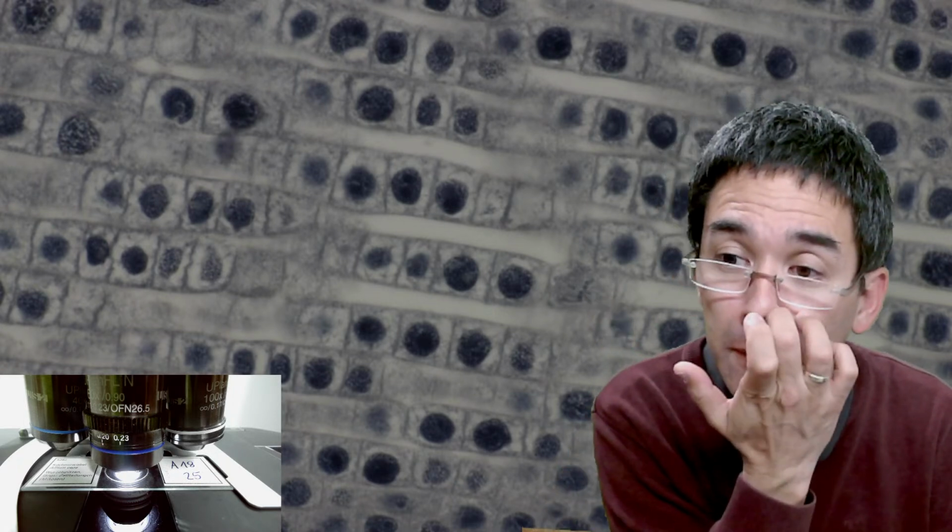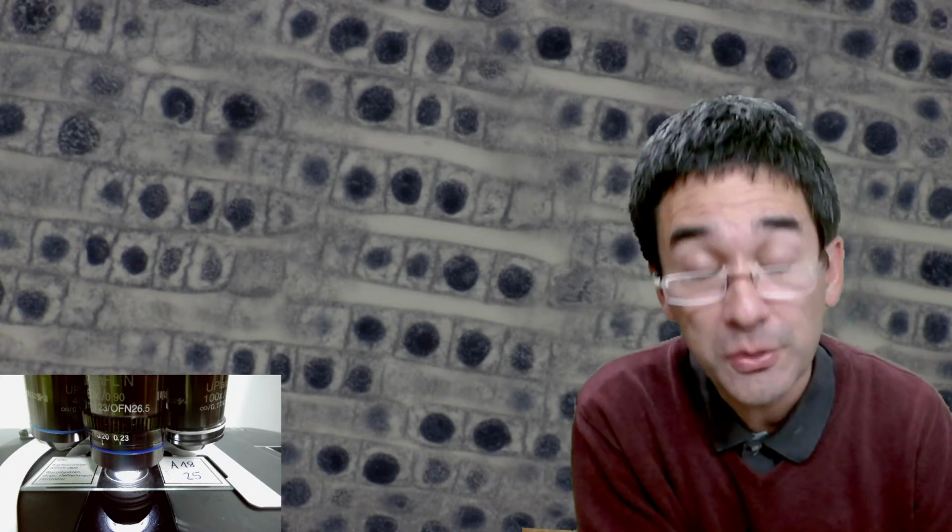So, is it possible to see meiosis under a microscope? Yes, meiosis can also be seen. But again, you'd have to get the correct sample. You'd have to get a cross section of the testes, because this is where meiosis happens if you want to use animal cells, or the ovaries maybe. So it should be possible as well, because the chromosome movement looks similar.